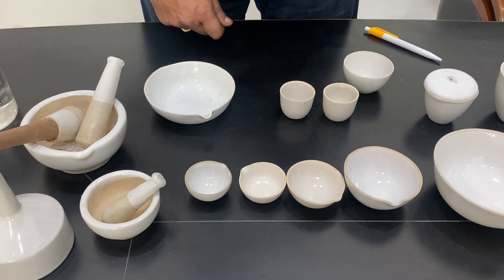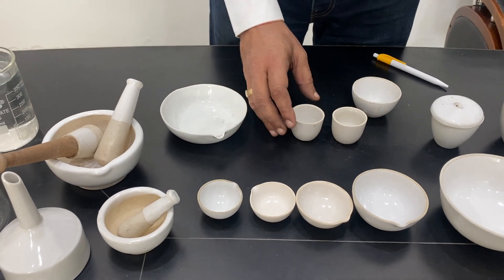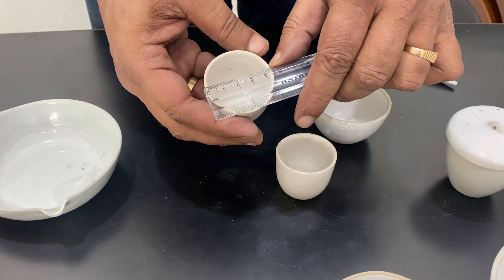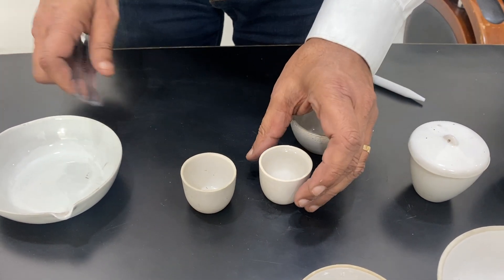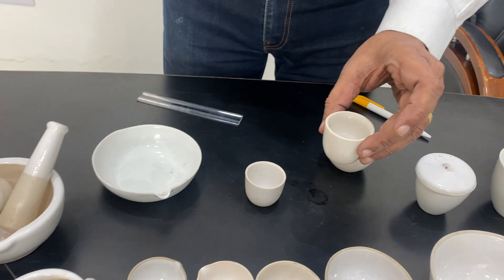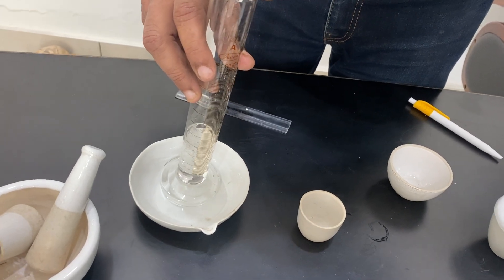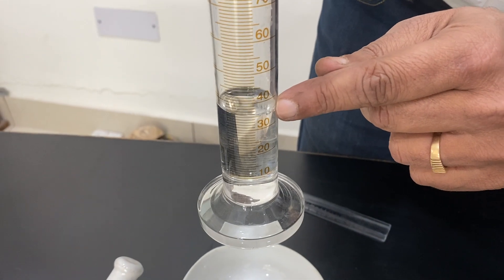And then there comes the crucible, which are called silica crucibles. These are porcelain crucibles. You can see these are approximately 2 to 2.5 inches, approximately less than 2 inches. They are generally measured in the form of ml. This one is 35 ml — I am just using a cylinder for measuring. This comes approximately 35 ml.